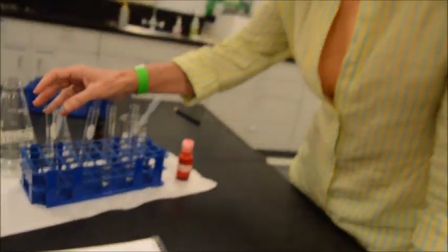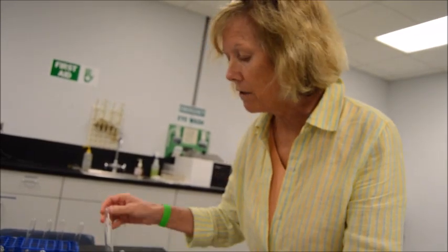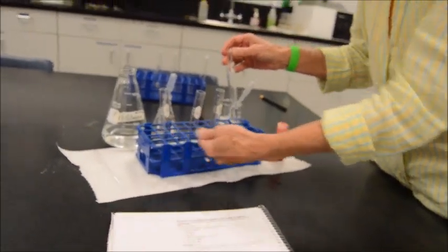You might wonder, why do we have to add water to the tubes? But remember, oil, for instance, if you have a positive lipid test, it has to separate away from the polar water. How's it going to separate if you don't have any water in there? Now, you can fudge and say you've got an oil test tube, just put it in there. But this is science, you have to treat all test tubes the same. So even the water test tube that had 2 mils of water in it has an additional 2 mils of water because every other test tube was treated that way.